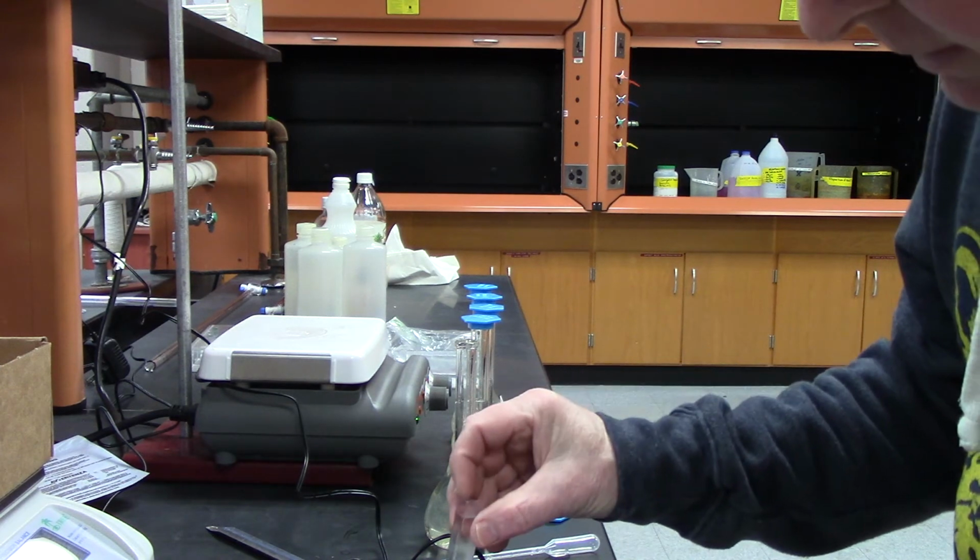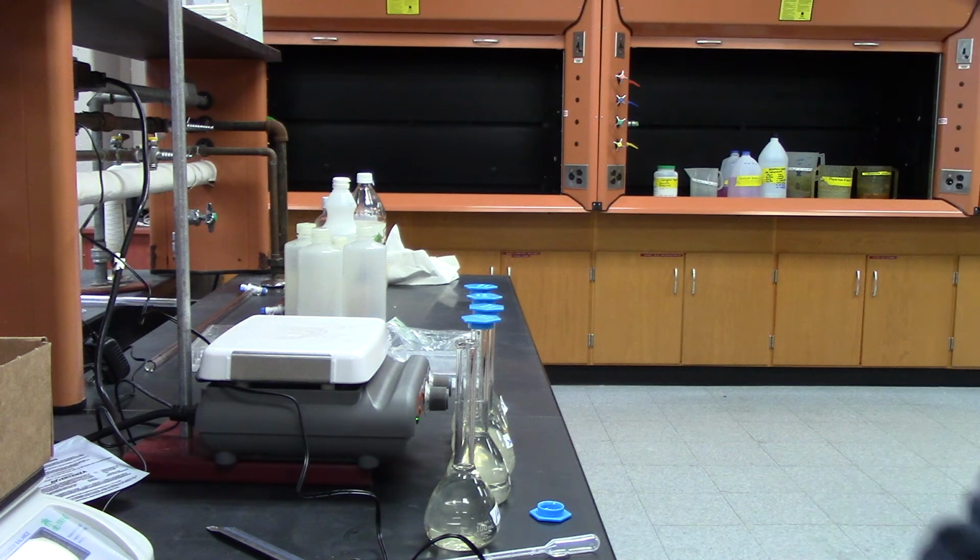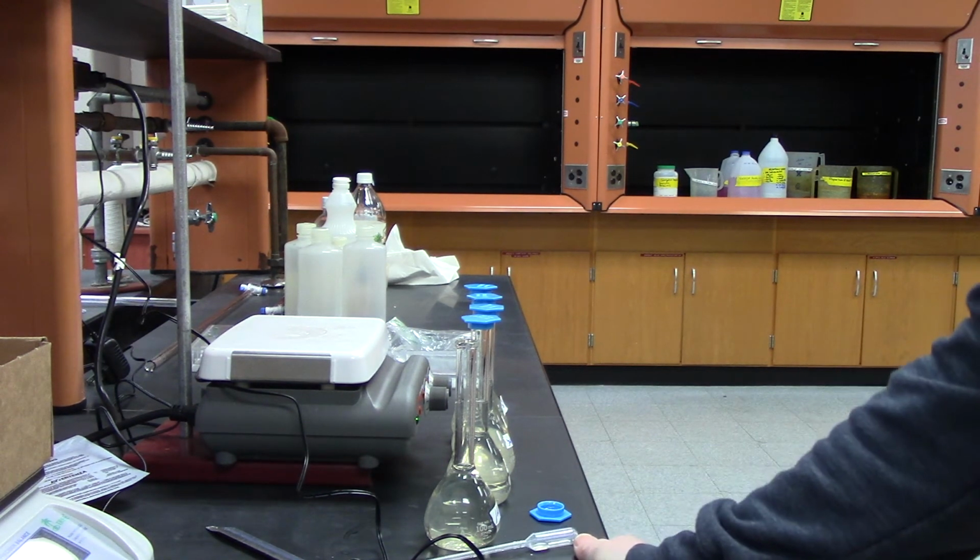Okay, it says put in the blank, so I'm going to put the blank in and finish calibration.